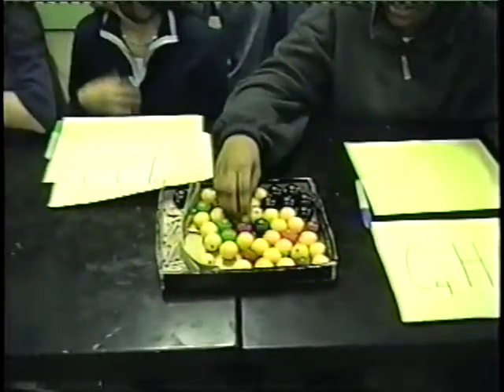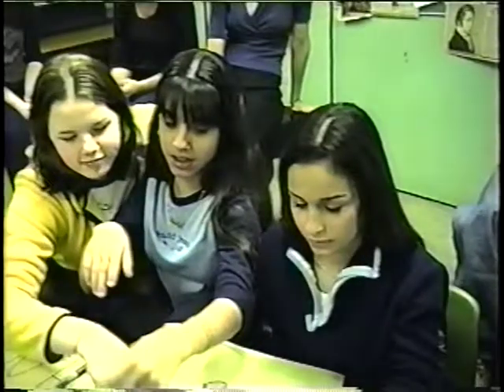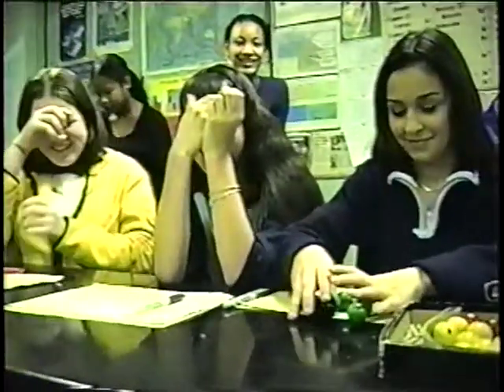Okay? All right, so now that you know what you're doing, here we have the beads. And what you're going to do is pass it around and, as Michael Jackson would say, beat it. Beat it, beat it, beat it. No one can be defeated. Something like that. Right? And we'll give them a little time here to do their thing.